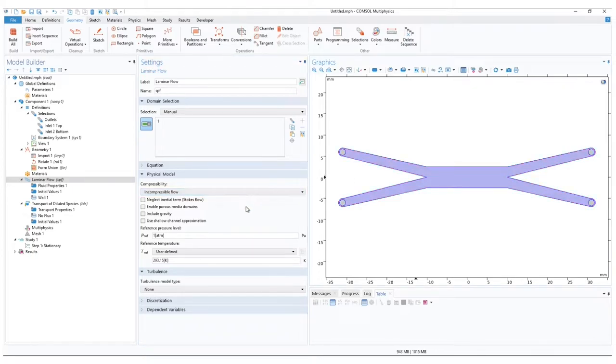Looking back at the settings, in many simulation physics, you can specify general ambient rules such as ambient temperature and ambient pressure, which for our case we can leave as is. Atmospheric pressure and 293.15 Kelvin or 20 degrees Celsius. For our microfluidic simulations, it is important to have compressibility set to incompressible. Next, we want to create the flow in our model, and this is one of the physics to do it with.